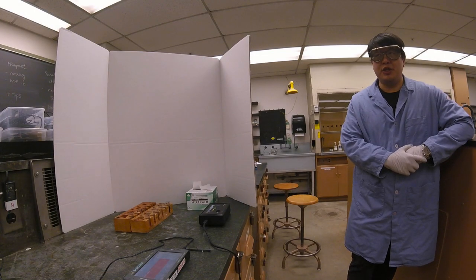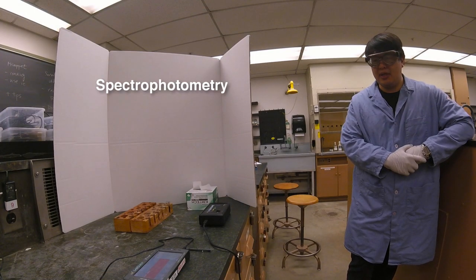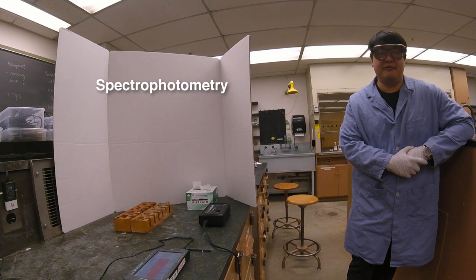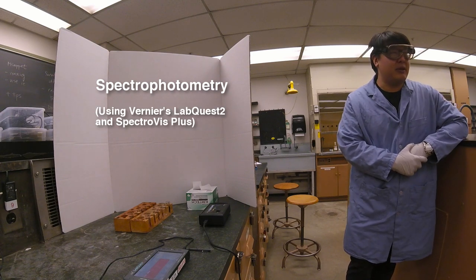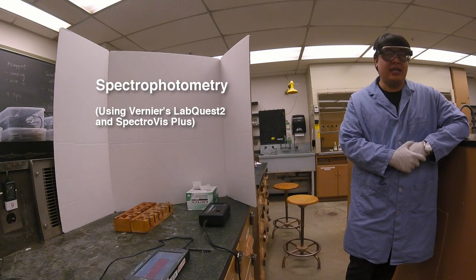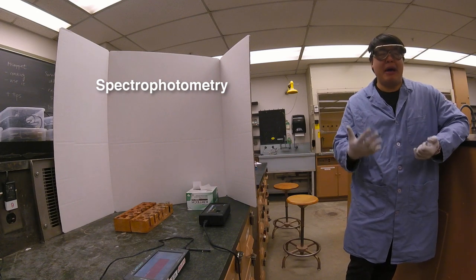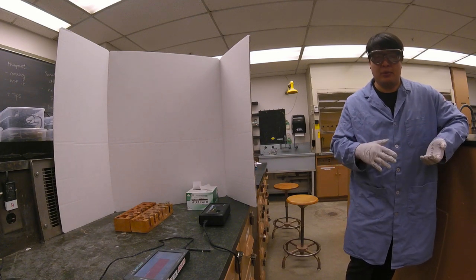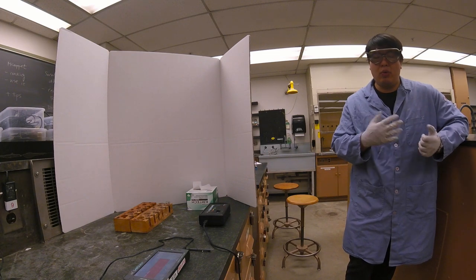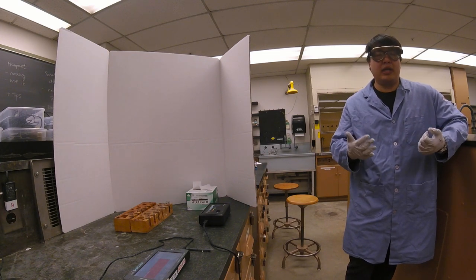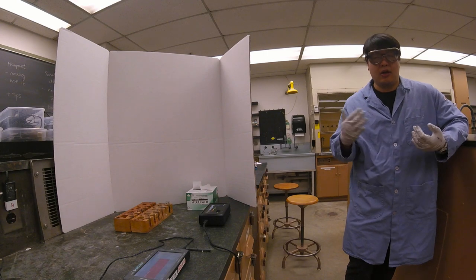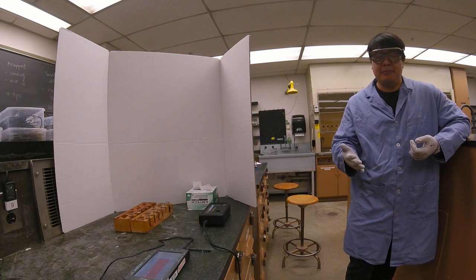In this video we're going to show you how to do spectrophotometry using the LabQuest device. Spectrophotometry, in a nutshell, means the machine measures the amount of light that gets absorbed. We can mathematically relate absorbance of light to the concentration in our sample.